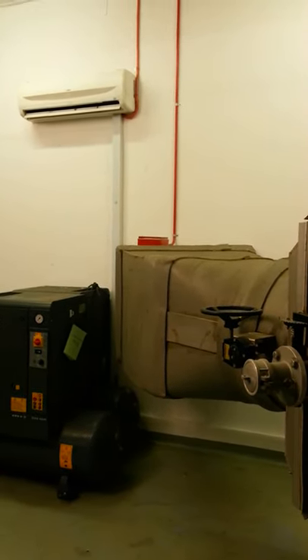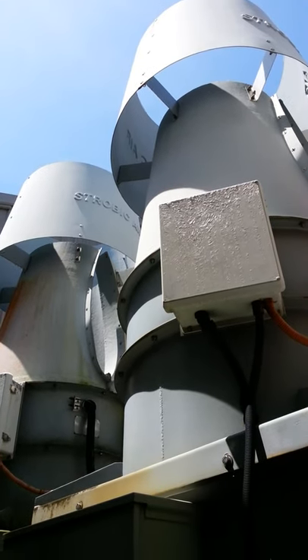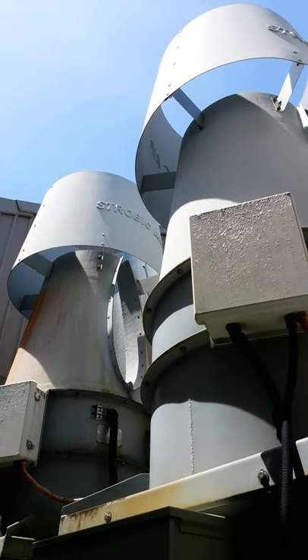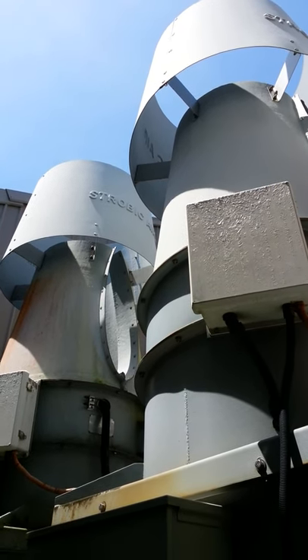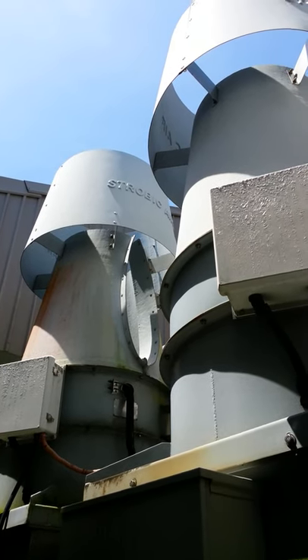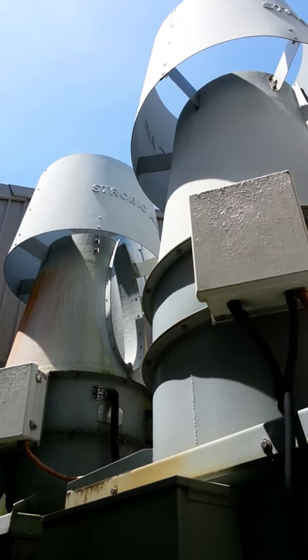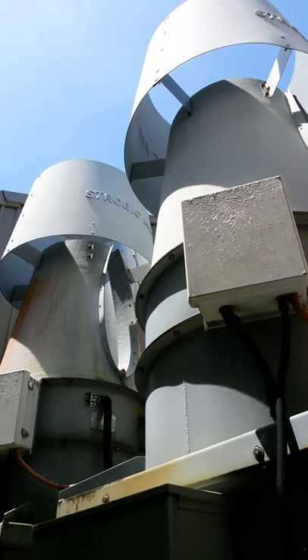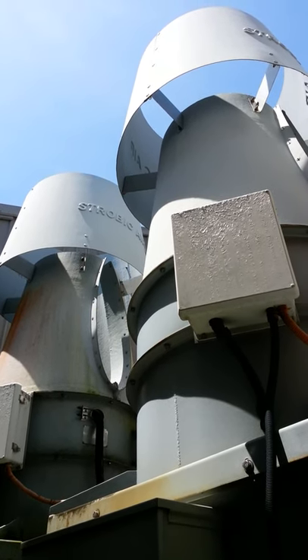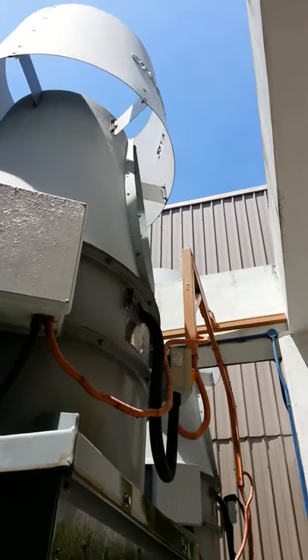I will proceed now into the outer space to show you the strobic fans. These are the high-plume fans, known as strobic air fans. All the air which exits from this facility is passed through a HEPA filter, and these fans will produce a high-pressure plume of air directed high into the environment, ensuring that all the pathogens are effectively filtered out from this facility prior to release into the environment.